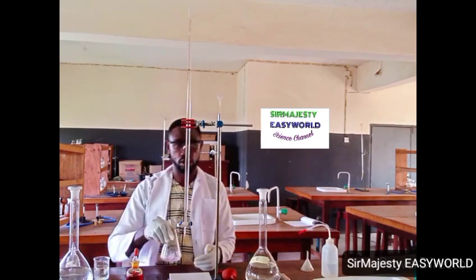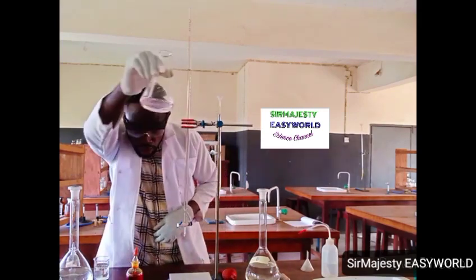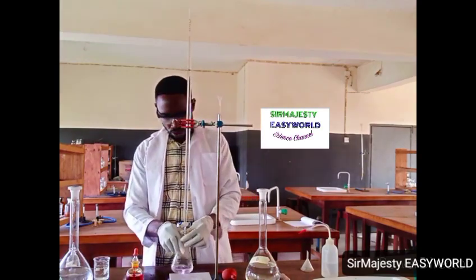See, it's colorless now. Requires a little drop.